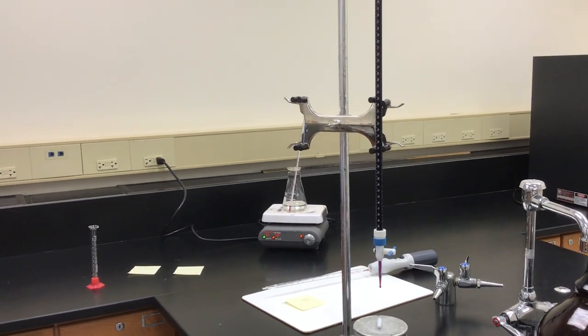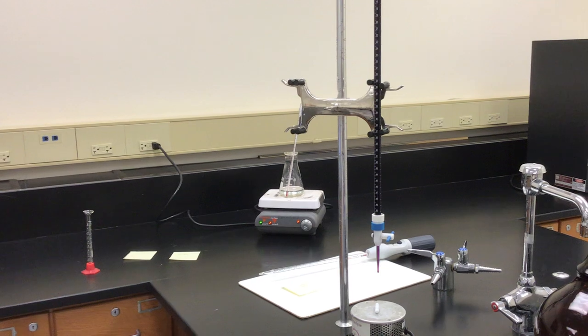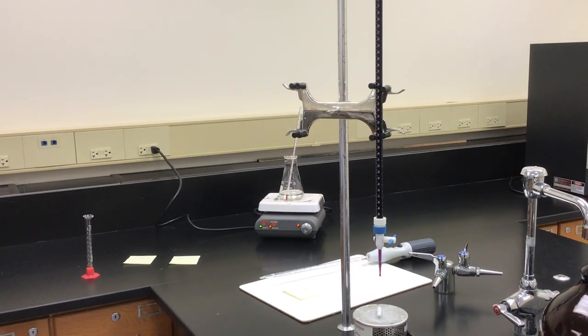While we're waiting for that solution to warm up, I thought I would give you a little picture of what it looks like in the background here.